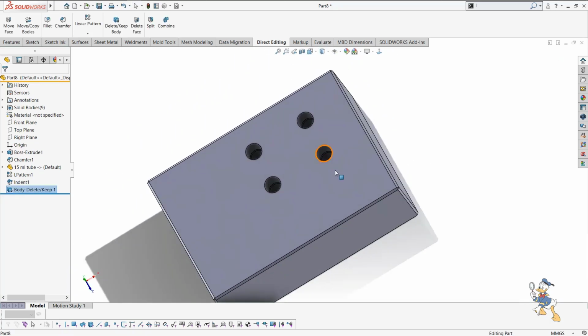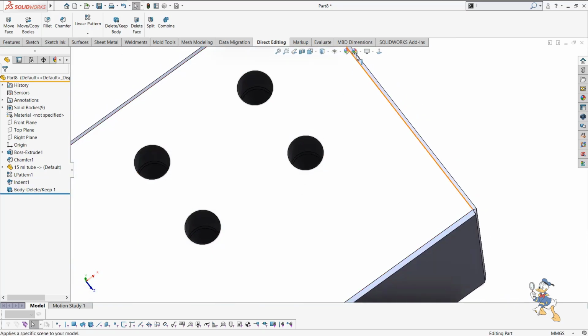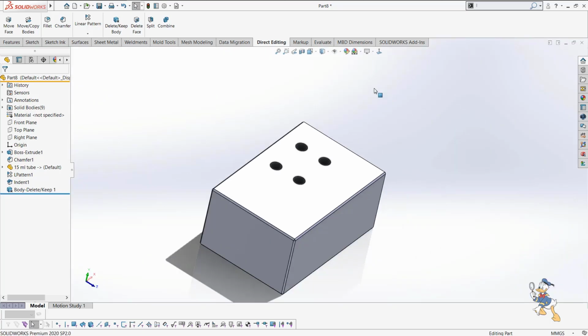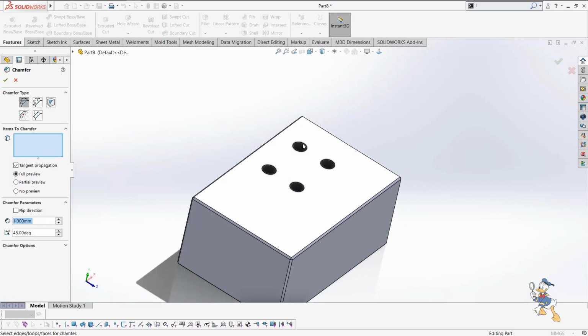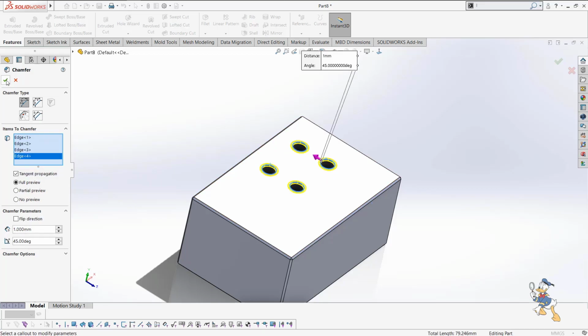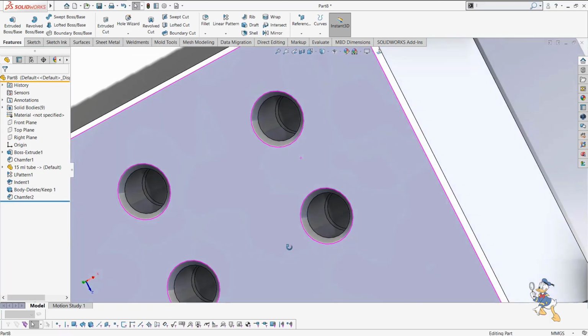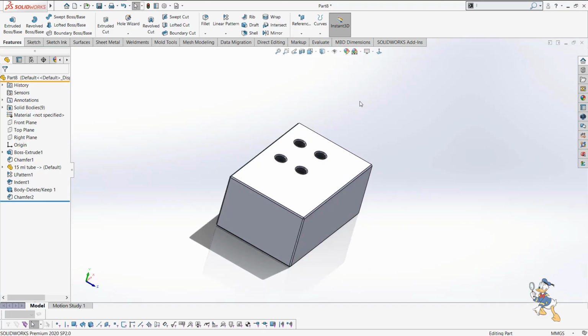So I have generated some sort of 4 holes over here, and we can see these holes are very accurate for designing purposes, because this is a medical tube containing some sort of blood samples or DNA samples for testing purposes. So we need much more accurate machining, and for accurate machining there must be accurate designing. So these features are very useful for designing machining components at an accurate level.